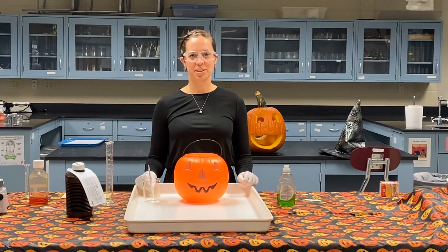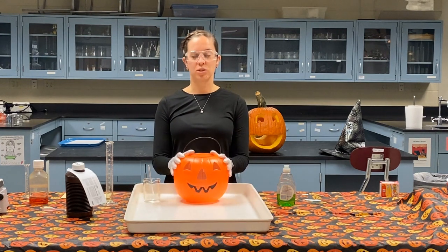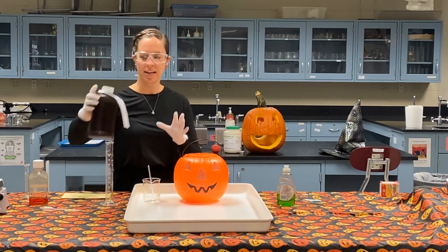Hi students, I'm Mrs. Roberts, another chemistry teacher from the second floor, and we're going to do a little bit of a twist on that demo that you just saw. So what I'm going to do is I'm going to call this our oozing pumpkin. So I'm going to take some hydrogen peroxide, and as Mrs.